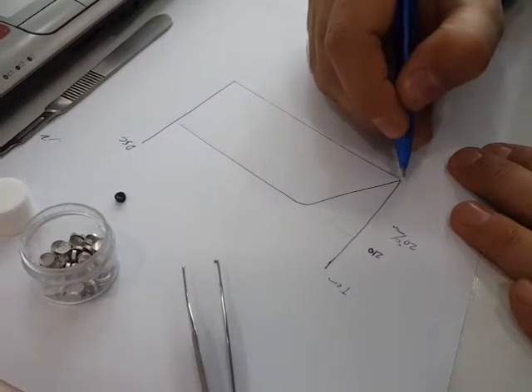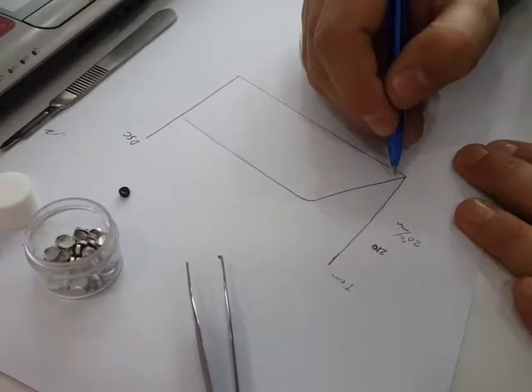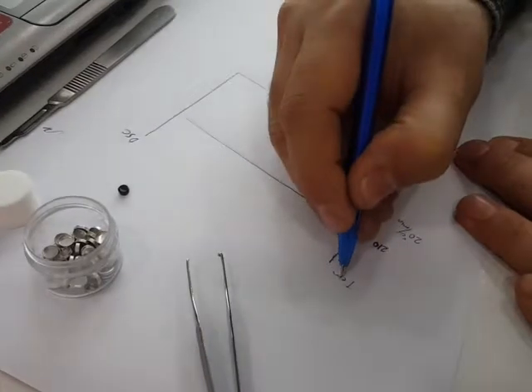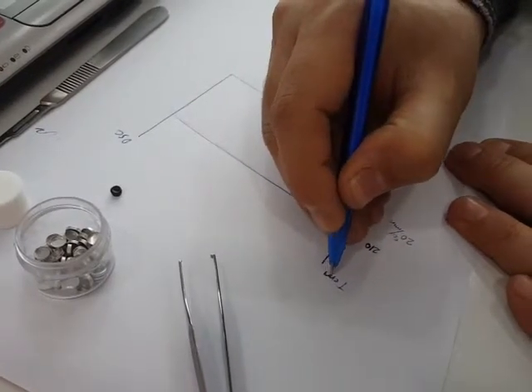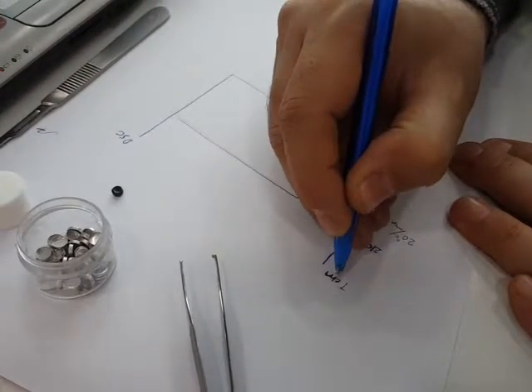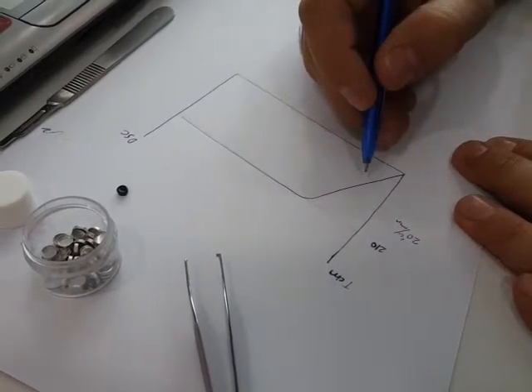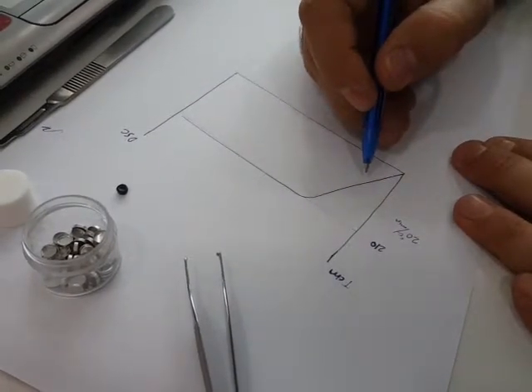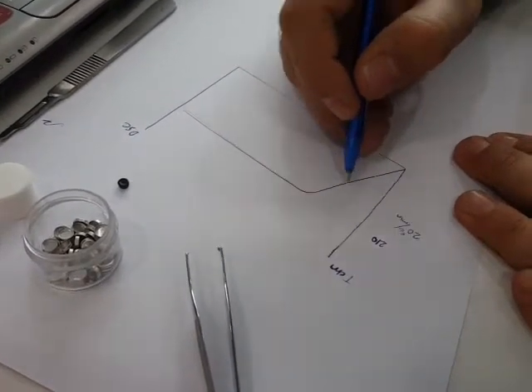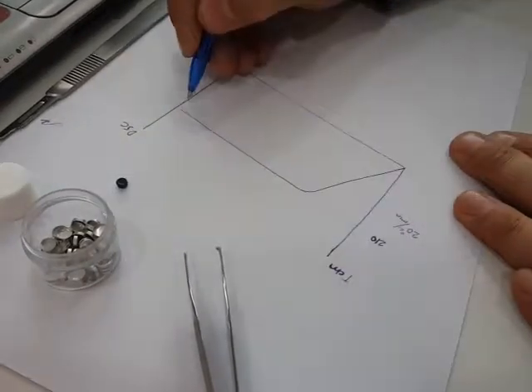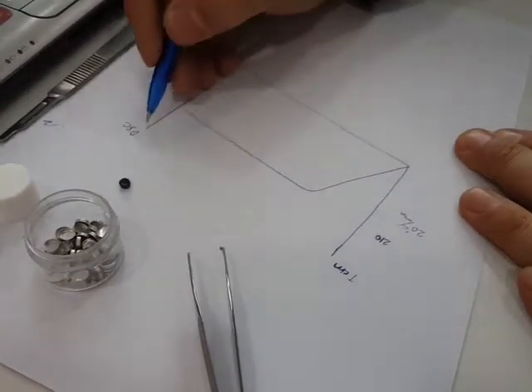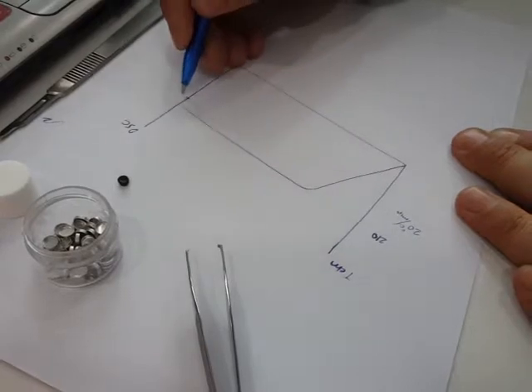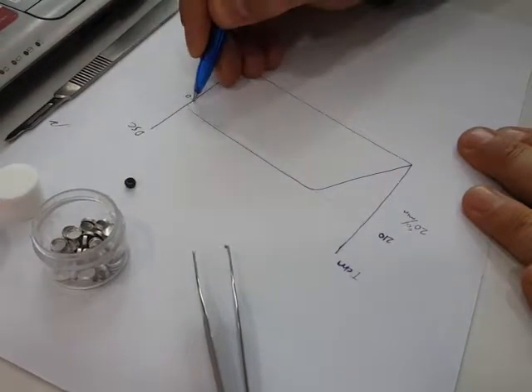When the temperature of the chamber is rising, nitrogen will be automatically opened. The sample need not to be oxidated during temperature rise. Here on the right side vertical line DSC, this is the zero line of DSC.